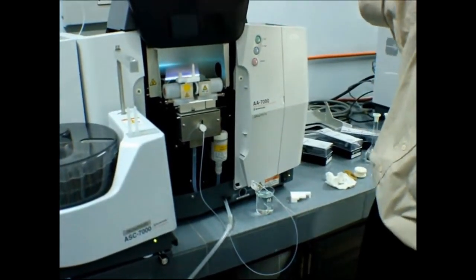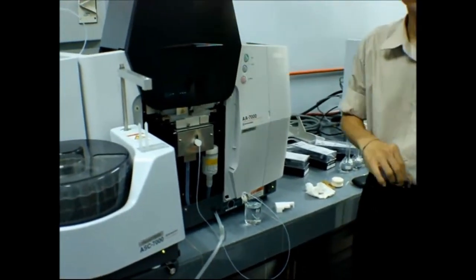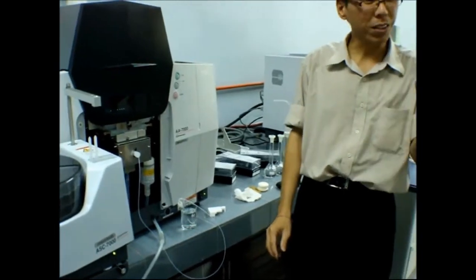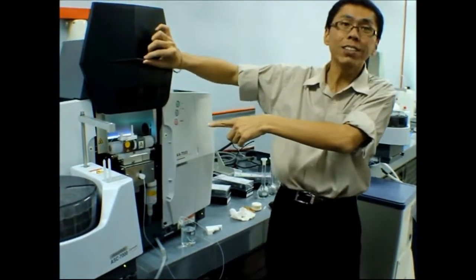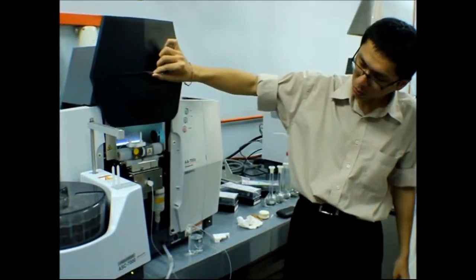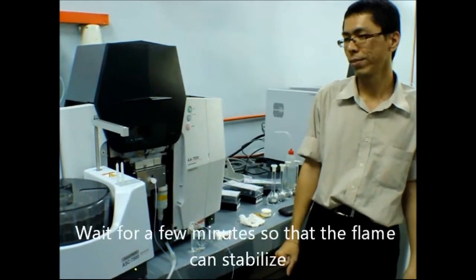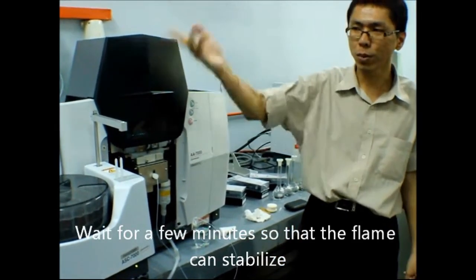Okay. Not bad. Your water is okay. Water still okay. If the water consists of a lot of things, you'll see your color is different. Maybe they give you red, green, or other color. But now still almost the same. So still okay, still quite clean. So wait for 2 minutes and you can run.